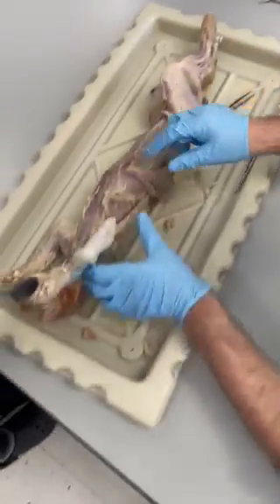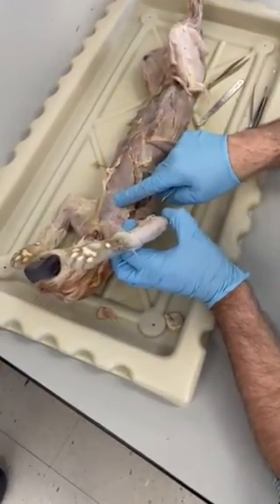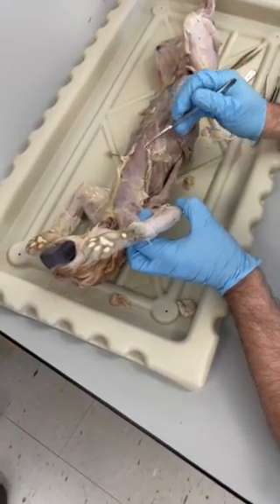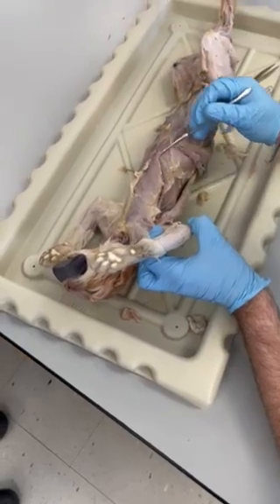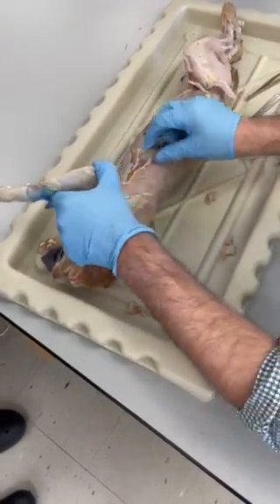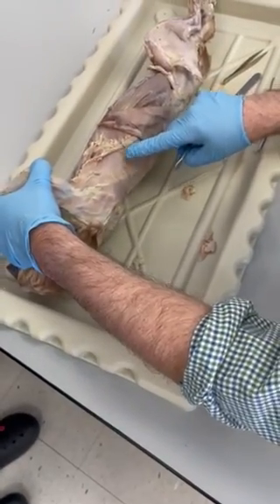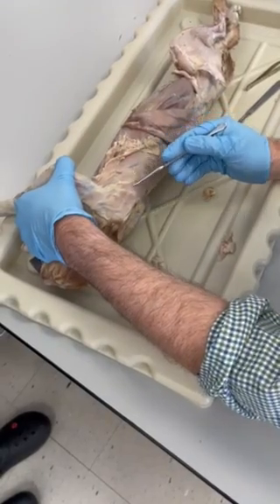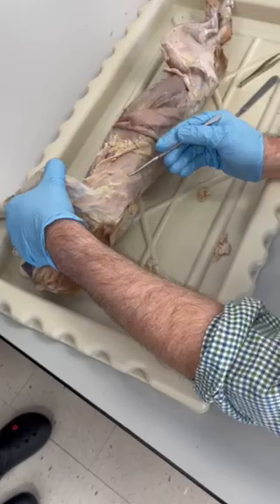All right, up here we've got the pectoralis major. Now, underneath and inferior to it is the pectoralis minor, but we're not learning that one necessarily on the cat. But just here it is. Here's latissimus dorsi. Don't get confused between latissimus dorsi and trapezius. You can see the distinction right there. There's one, there's the other.